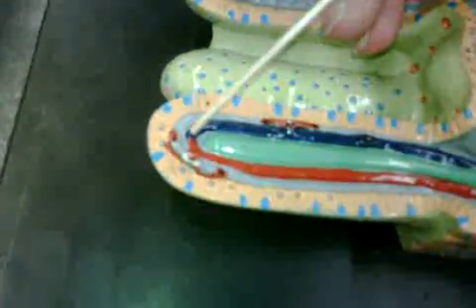Okay. The capillary net. Okay. Arterial venous anastomosis. And that's wherever an artery and a vein meet without a capillary in between. So right there is a good example of it.